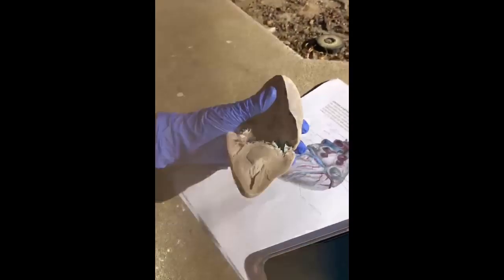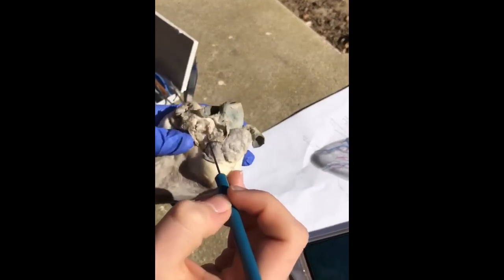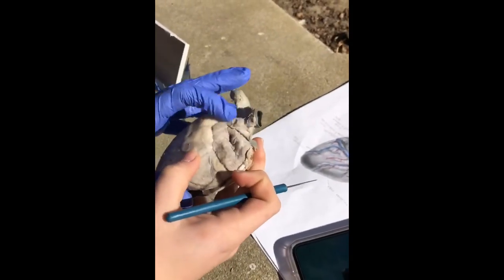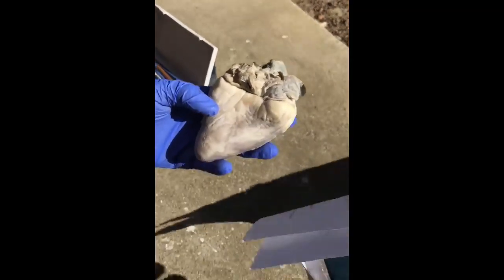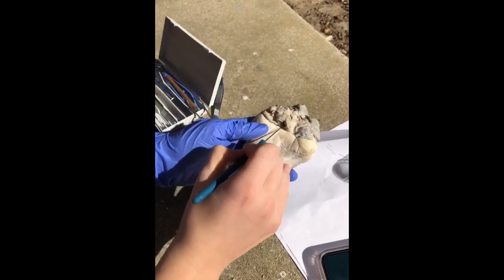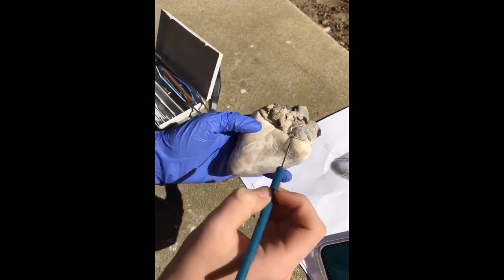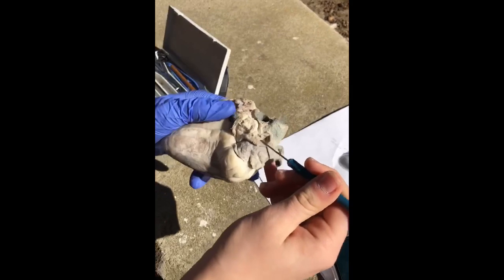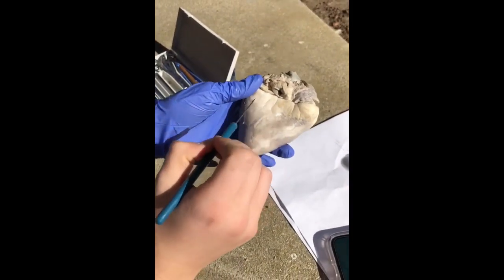And then from there we have the pulmonary arteries, which are going to be up here somewhere along the pulmonary trunk. And then we're going to have the pulmonary veins, which are going to relatively be around here. So some of these smaller vessels. And then the superior and inferior vena cava is going to be this vessel up here. This is going to be superior, which then leads down here to the inferior vena cava.